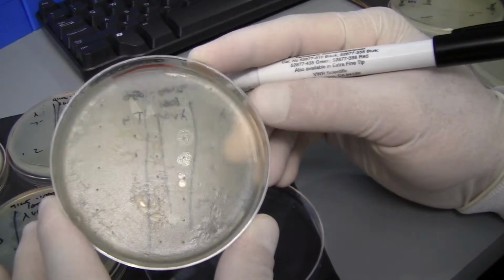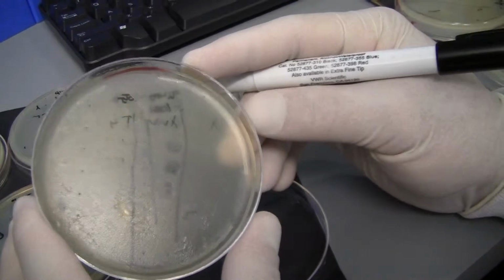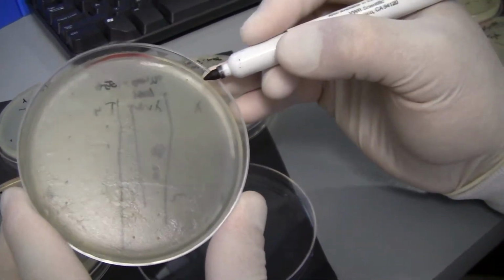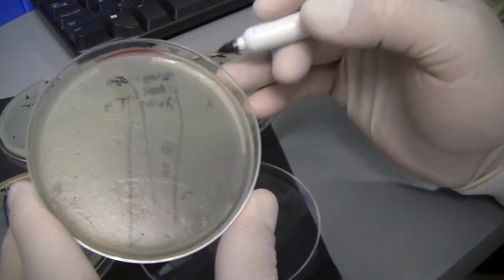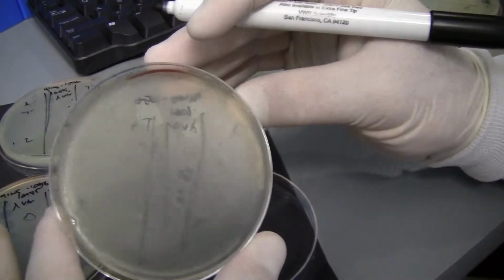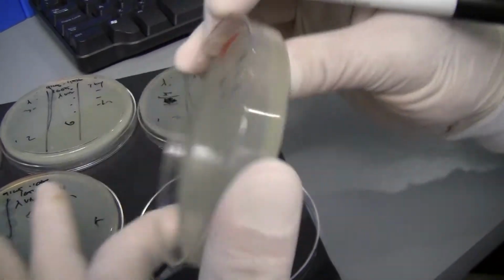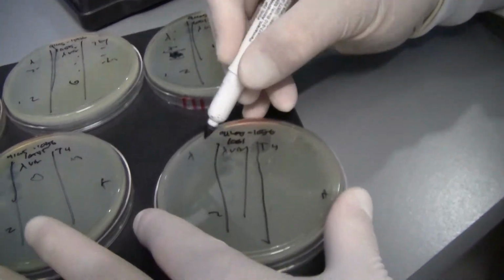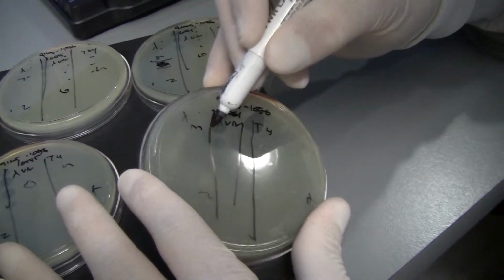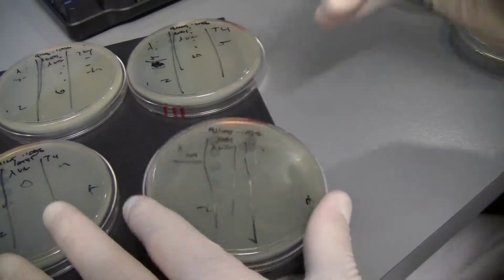The phage plates just don't turn out as well, but we can still use it. Our lambda phage here, it looks like we have a little bit of clearing, unfortunately, so this one was not protected as well. This is MC1061, which actually makes sense. I've done other experiments that have kind of shown that MC1061 does not get protected. So I see 1, 2, 3 orders of magnitude here, clearing.